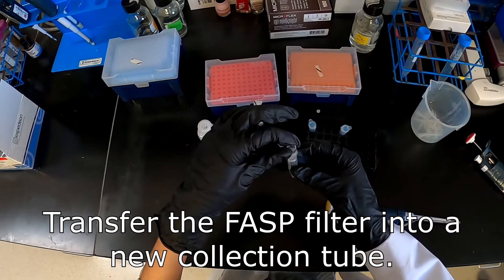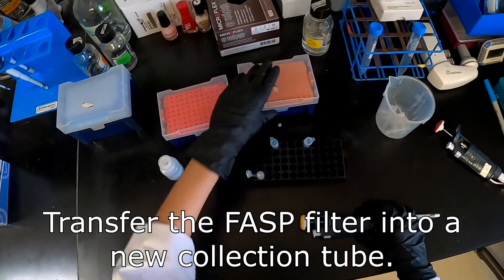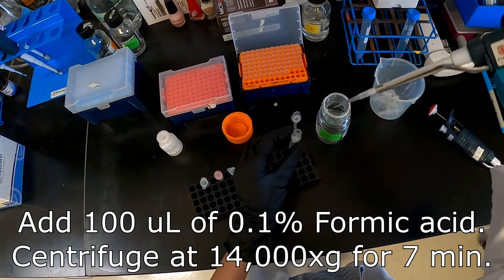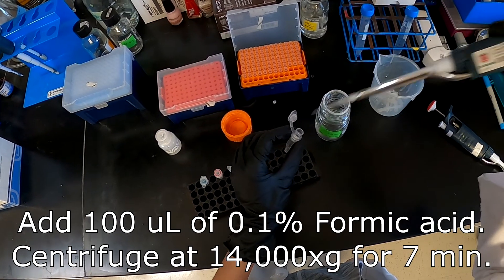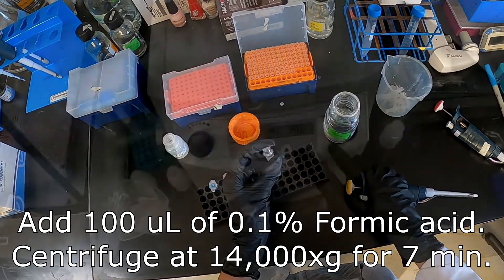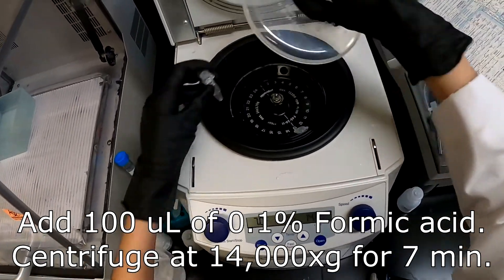After this incubation, the filter was then transferred to a new and clean collection tube. 100 microliters of 0.1% formic acid was then added to the filter. Formic acid will be used to stop the digestion. It was then centrifuged at 14,000 G for 7 minutes, twice.